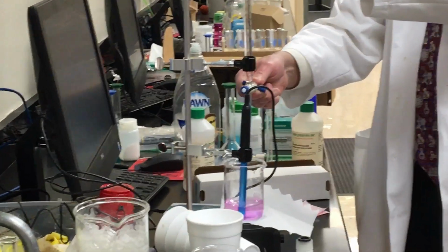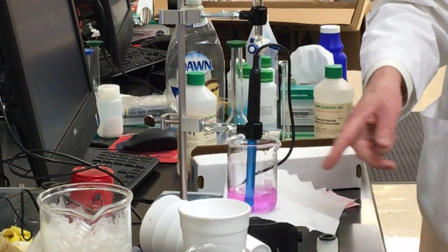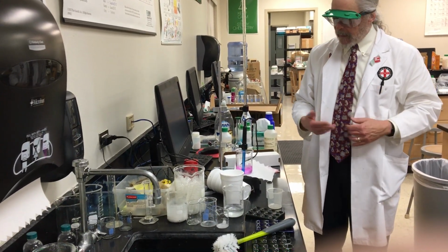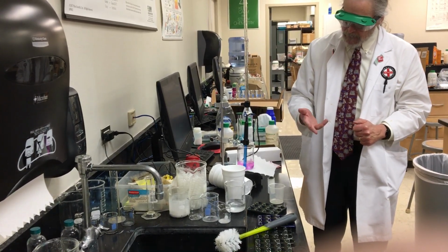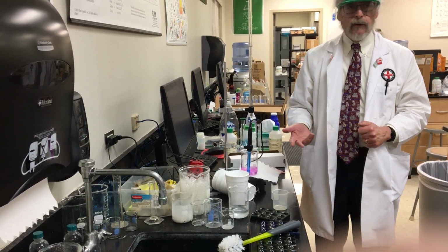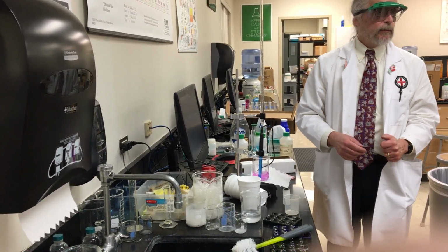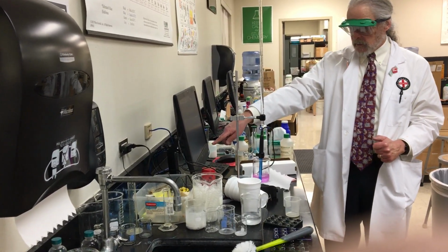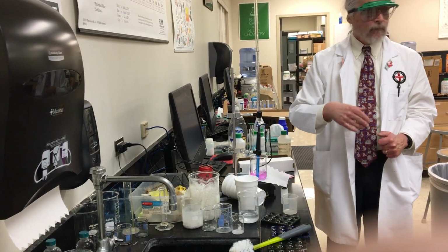The end point of the titration is the first drop where it turns pink and stays pink. Okay? So I add that and I go, it's pink, and if it goes 20-30 seconds and it doesn't fade, I go, that is my equivalence point. And according to this, that's not bad, because that's like 7.63. That's right about where it ought to change.